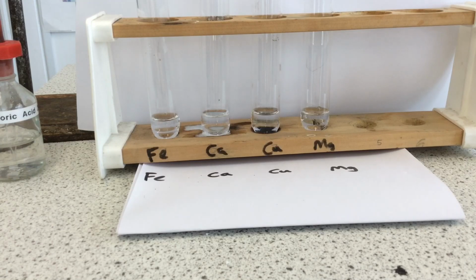Now, calcium clearly reacted with water. I guess you can have an idea what might happen with hydrochloric acid. We're going to have a look at what happens with these other metals as well, and then we're going to actually try and trap the gas to see if we can prove what gas it is. It might be a bit difficult in calcium's case because calcium is very reactive and the gas might overload the boiling tube. Please note we're now using boiling tubes because we only have one size bung in the labs at the moment to capture gas.